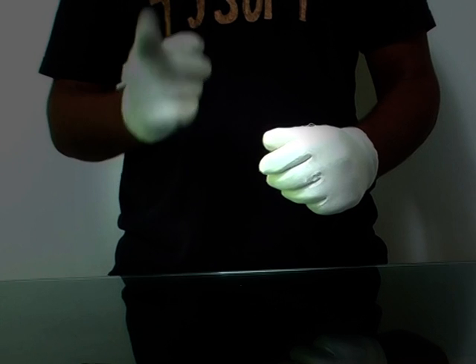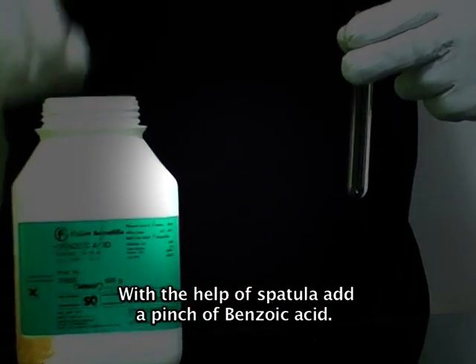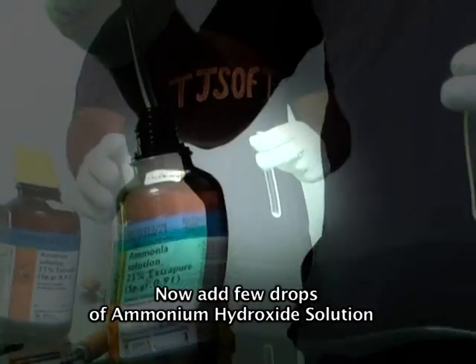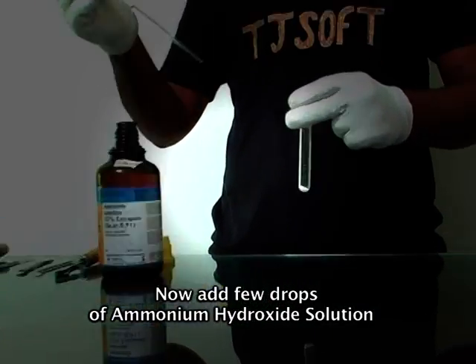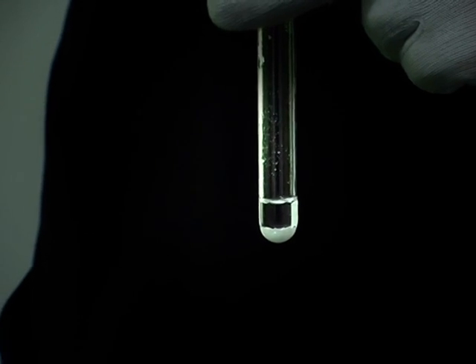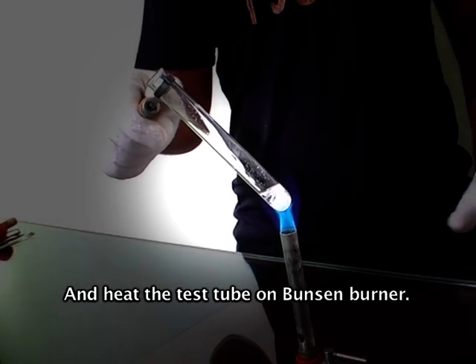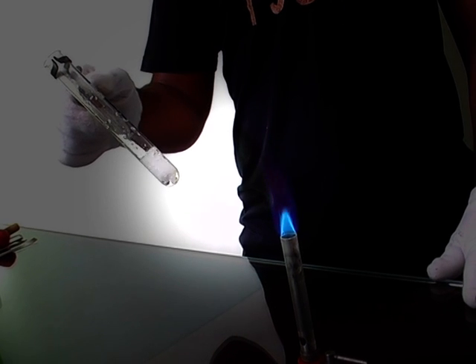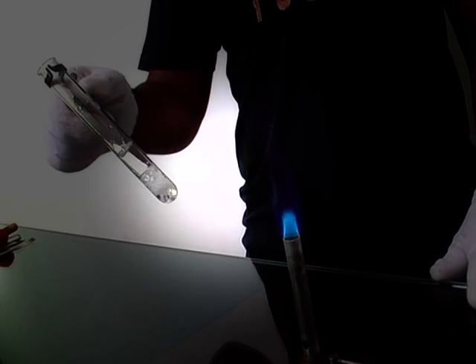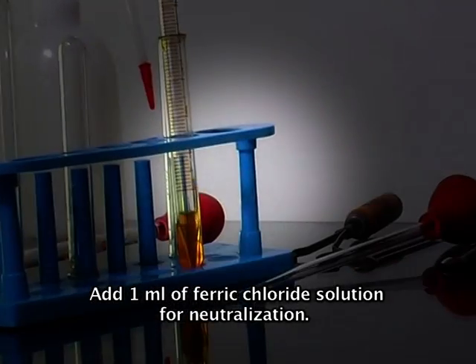To confirm it again, take a clean test tube. With the help of a spatula, add a pinch of benzoic acid. Now add a few drops of ammonium hydroxide solution. Hold it with a holder and heat the test tube on the Bunsen burner. Add one ml of ferric chloride solution for neutralization.